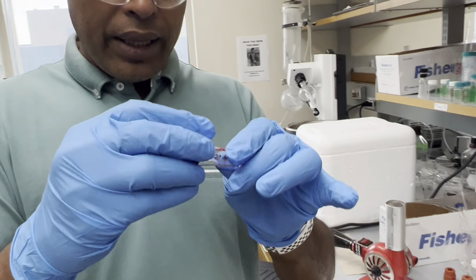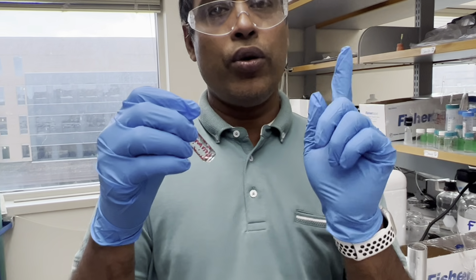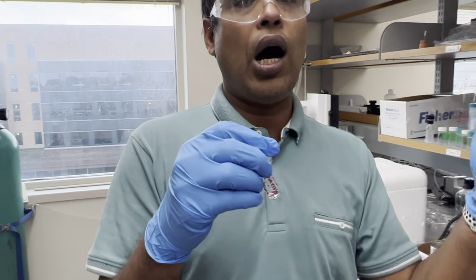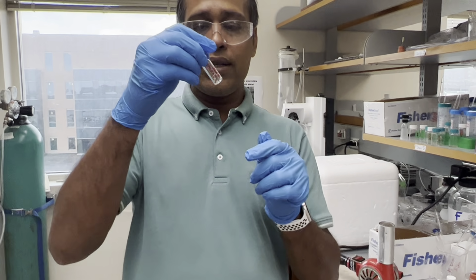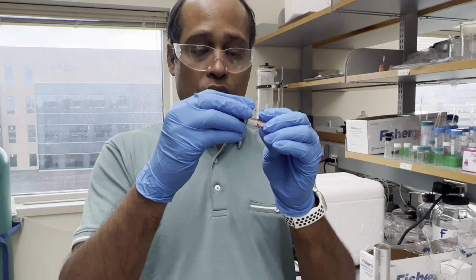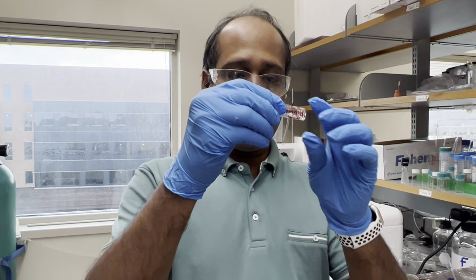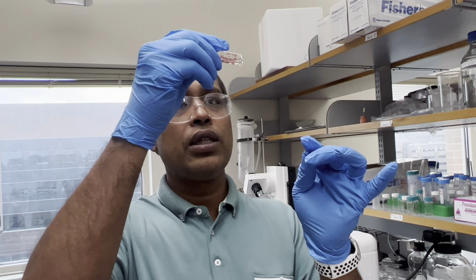Before this measurement, I took compound from my original part that was dissolved in methanol and checked the pH, whether it is basic or acidic. It looks almost neutral on the pH paper. That's why we are using a very small amount, maybe 5 to 10 microliters. I'm just dissolving it because that part was in the vial, so it will take a little bit of time to dissolve.